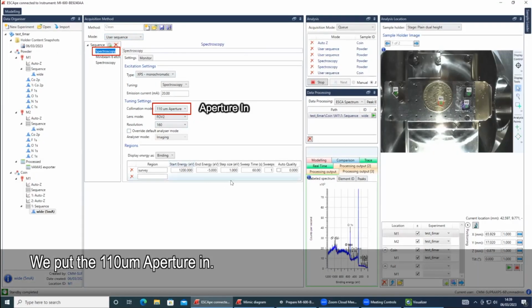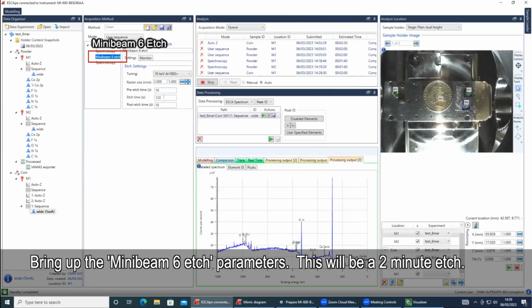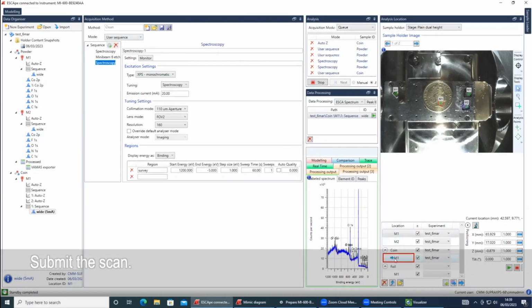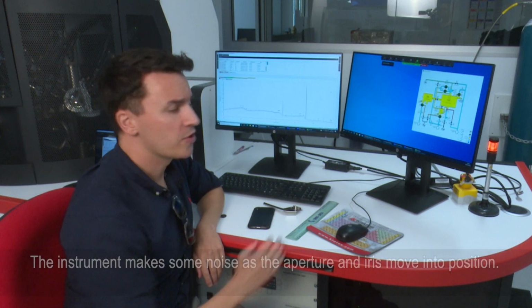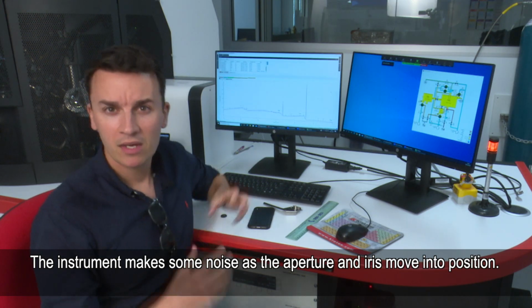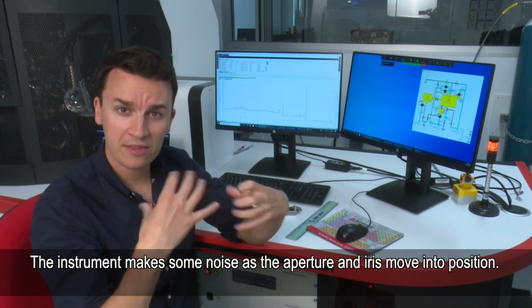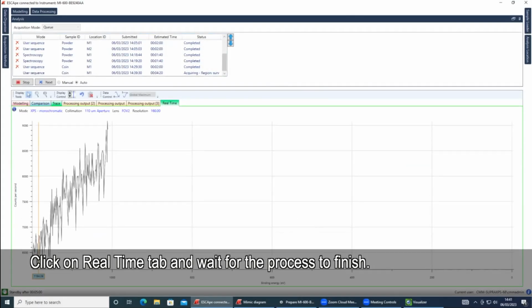So we put an aperture in. We do a 1 minute scan. We'll then do the mini beam 6, which will be a 2 minute etch, and then we'll do another scan after that. So I'm just going to submit this. This will take about 4 minutes: a minute for the first scan, 2 minutes to do the etch, and then a minute for the final scan, and then we should get some better results. As that's running, the instrument makes a bit of a noise, and that's the aperture and the iris going into place and changing the aperture. So I'll go back to real time here, and we'll just wait for it to finish.